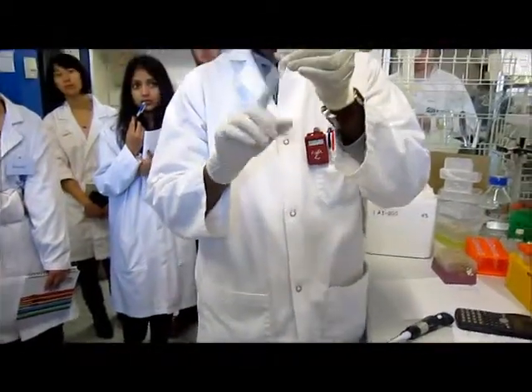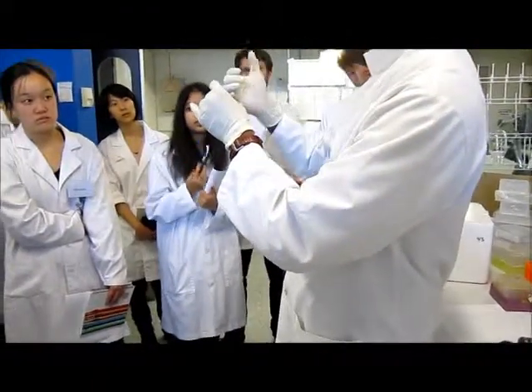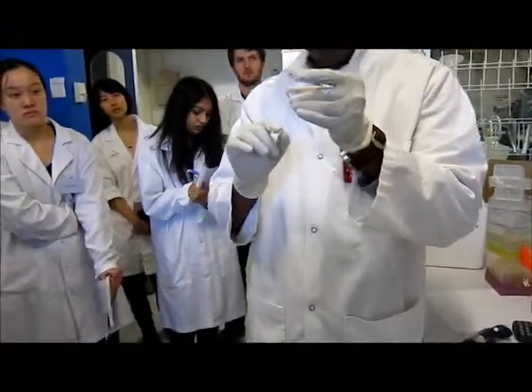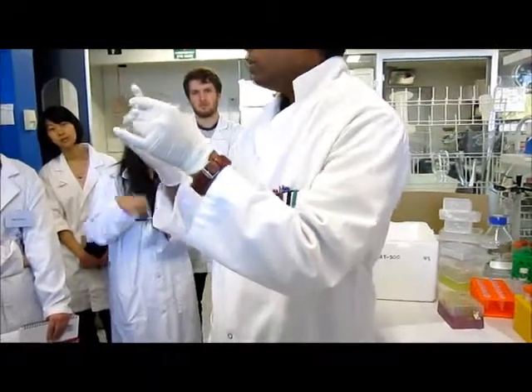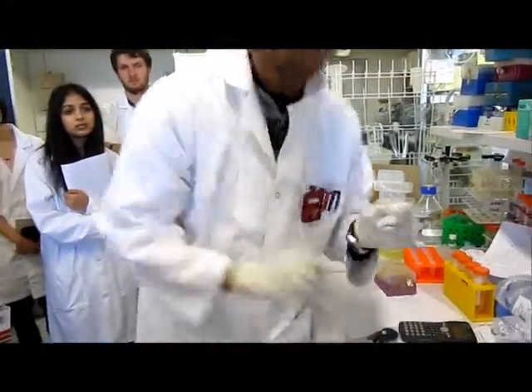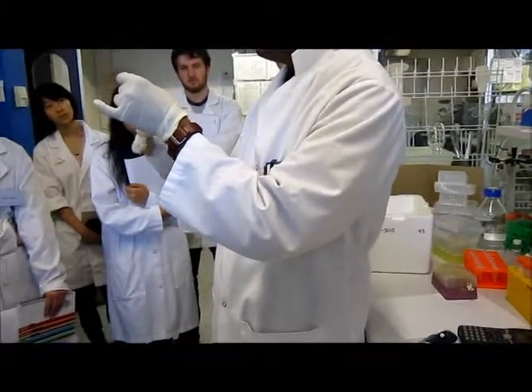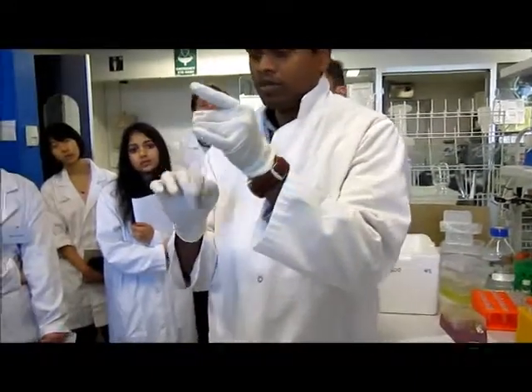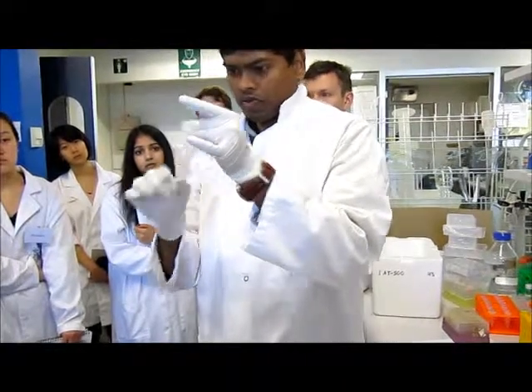For the mixing, what you can do is these sorts of flips, or you can use your pipette tips and just pipette it up and down. As long as it's not a big volume, that's why I'm just flipping, because whenever you take another fresh pipette tip and do the pipetting up and down, eventually you will lose some. You know what I mean? It will just stick to the outside of your pipette tips sometimes. You can do that, but I think that's okay.